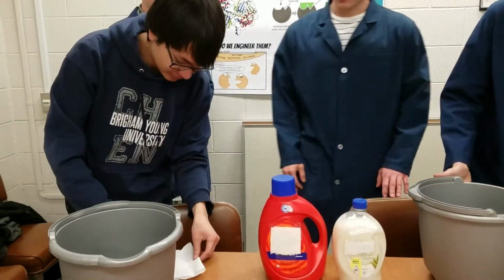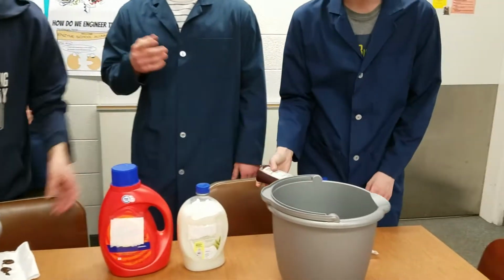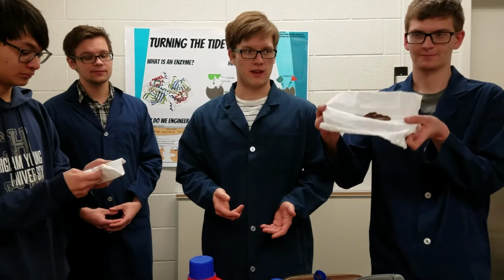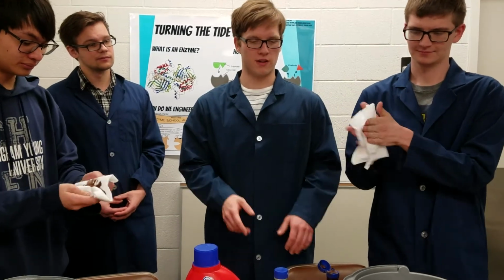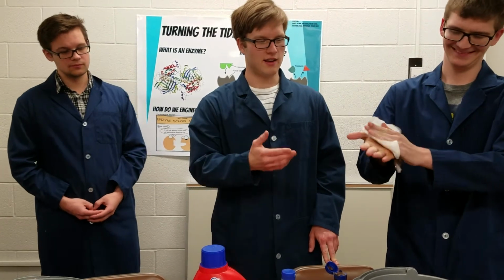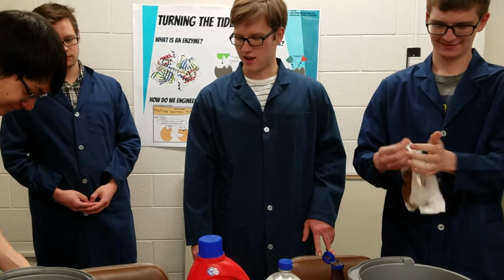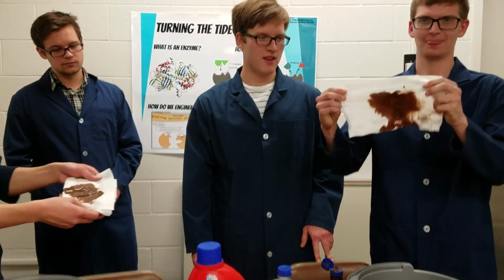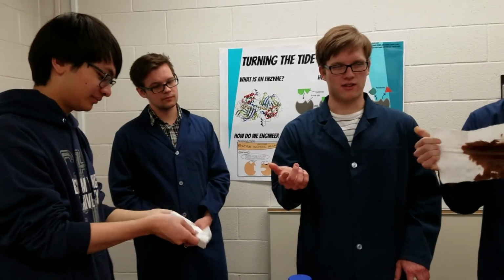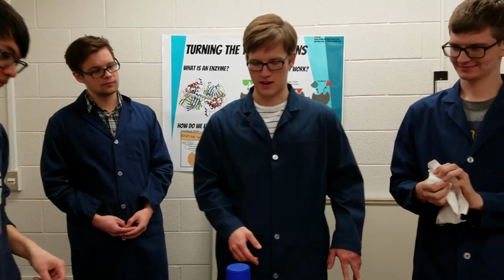So what we'll be doing is you can have your students come up here and stain the cloths with some chocolate syrup. We found that chocolate syrup works best when comparing soap with laundry detergent. And it's a good hands-on activity for them to do. So we got those cloths stained, guys. Now obviously you don't have to use this much. Even a little dollop will do, but this will show the effects very clearly.